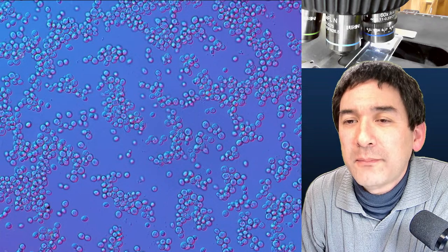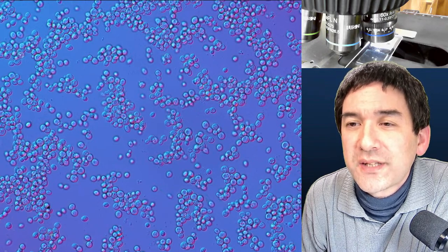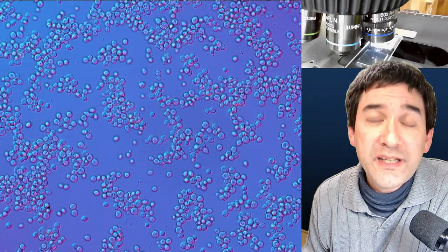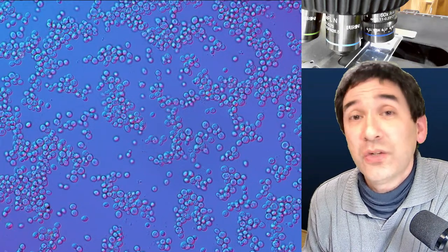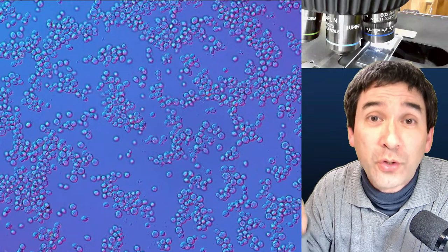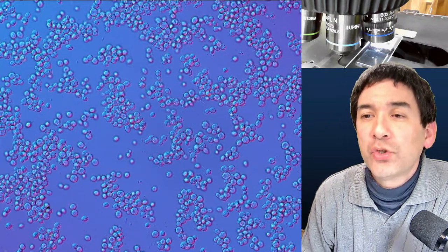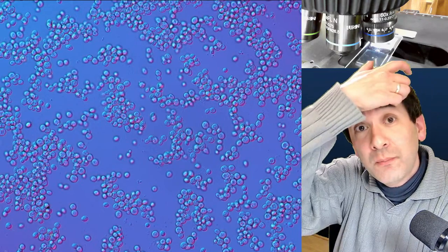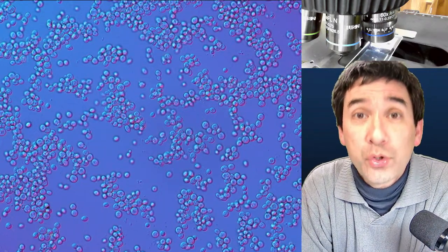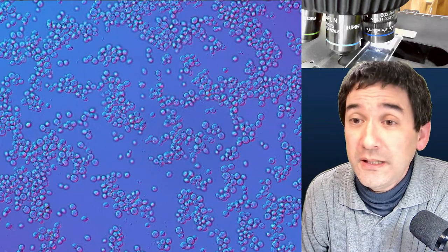In OBS Studio you can also capture a screen or window, so if your camera requires specific color correction software you can project it on screen and capture that window in OBS. Regarding 100x oil immersion phase contrast objectives — yes, of course they exist. In fact, 100x oil immersion phase contrast objectives are quite commonly used specifically for observing bacteria at high magnification.